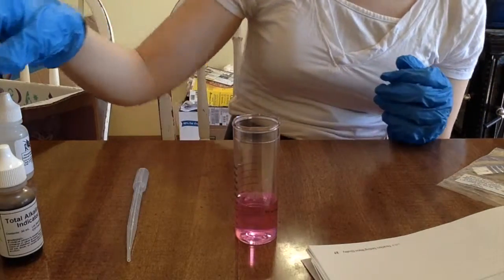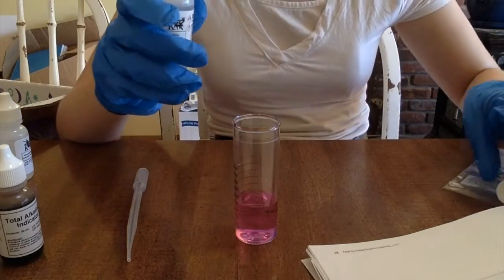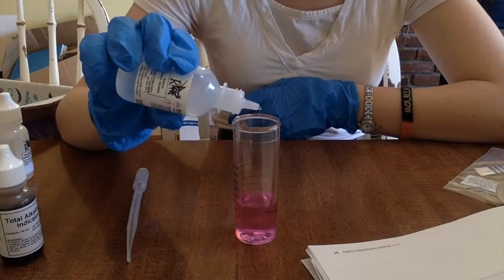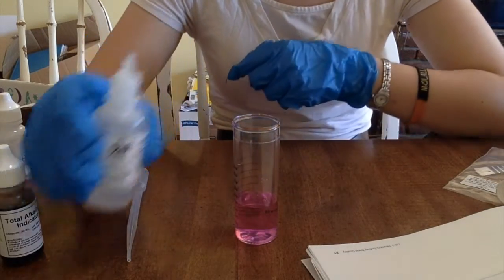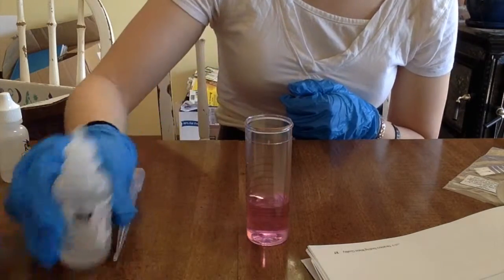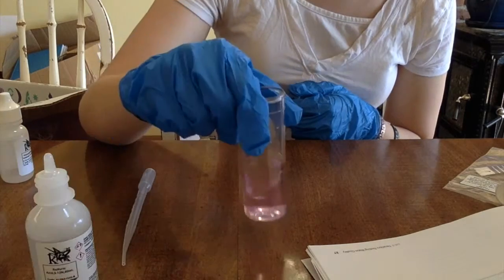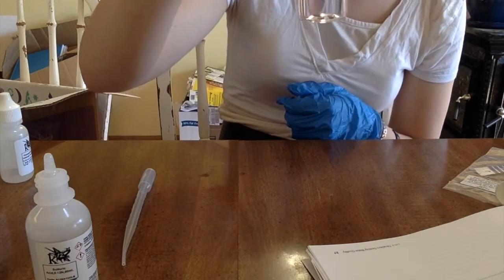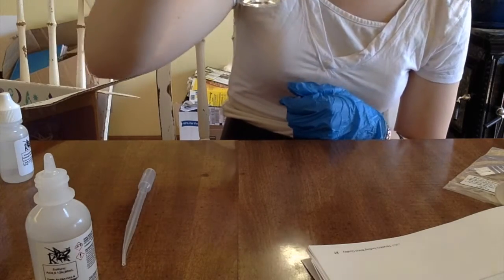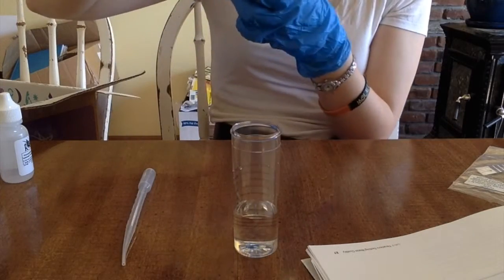We need one drop of alkalinity titrant low, which is sulfuric acid, and then swirl for color change. We want it to go until it is clear. One, two, three, four, five, six, seven. We're gonna stop at seven and swirl it. Seven, eight, nine, ten, eleven, twelve. Thirteen, fourteen, fifteen, sixteen, seventeen, eighteen. Almost there. That's pretty clear, there's no more pink in that. We have it clear. That was eighteen drops.